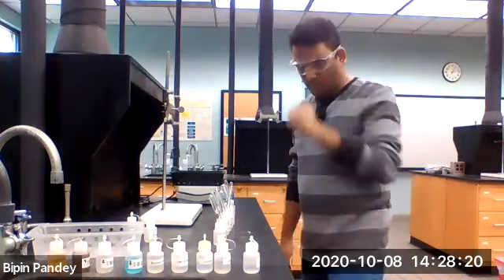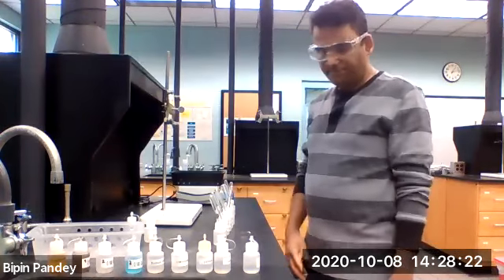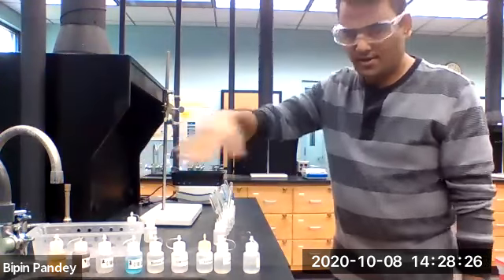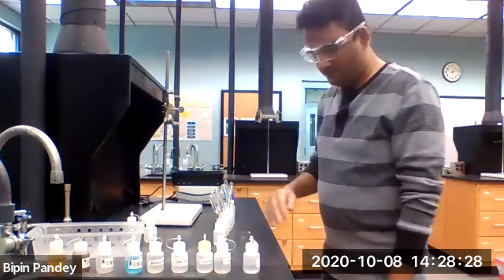Hello and welcome to the Solubility table lab. So I have all my cations up here and I have all my anions up here.